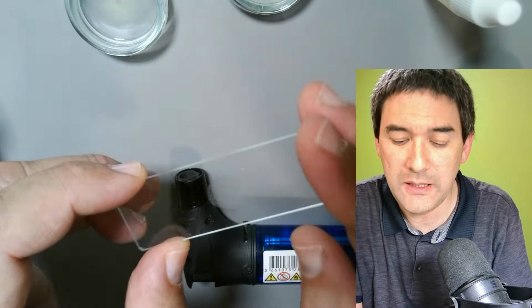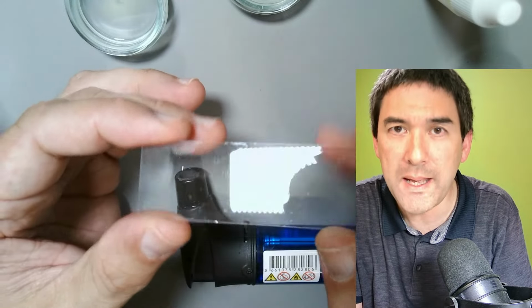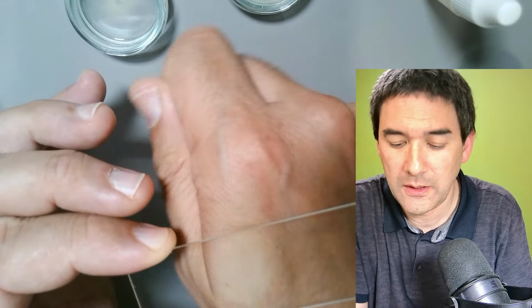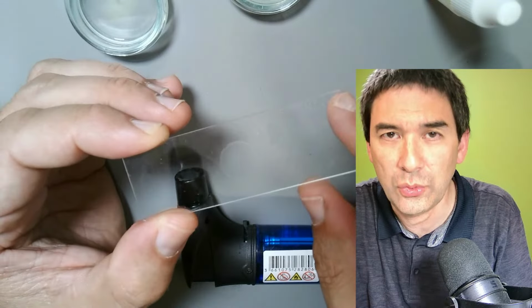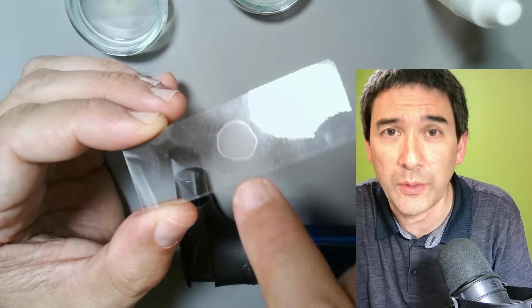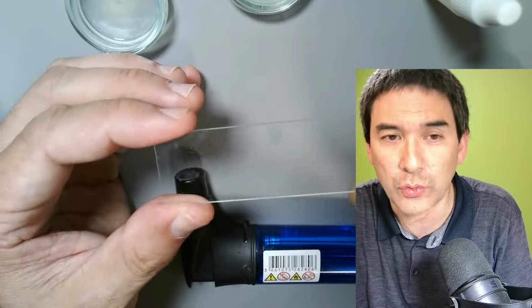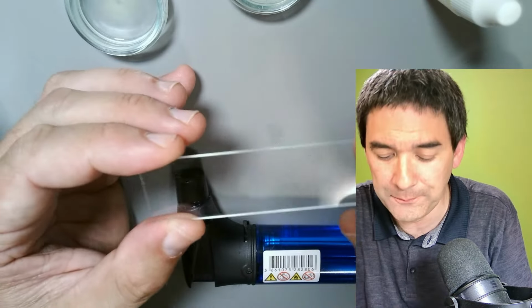This basically means that now the cells should be baked to the glass slide. Still hot, and I allow it to normally cool. You are only allowed to do that once, and not when it's still wet. Otherwise it's going to start boiling, and then the cells are going to boil apart. But when it's dry and you do that, the cells should still remain intact.